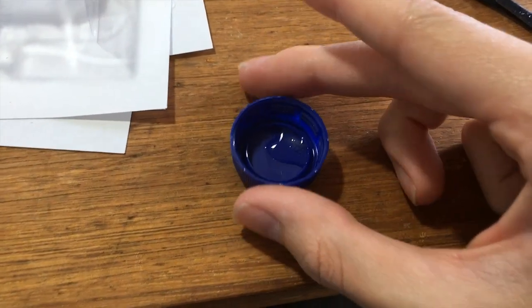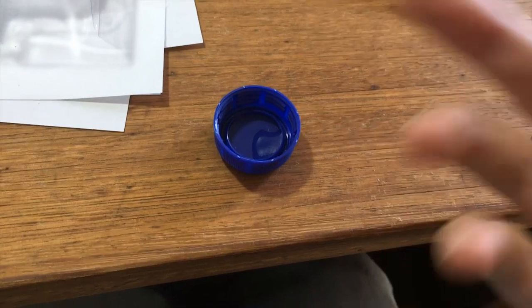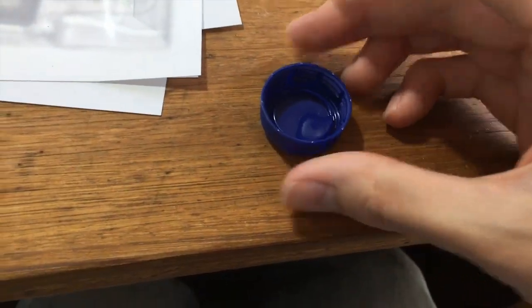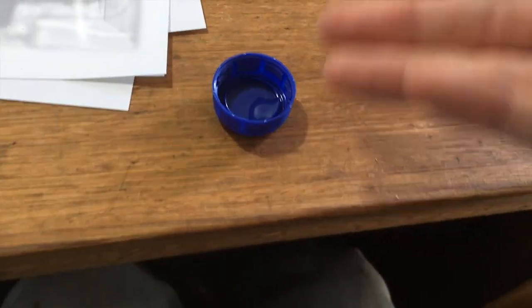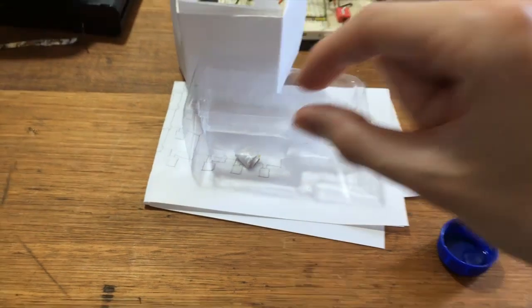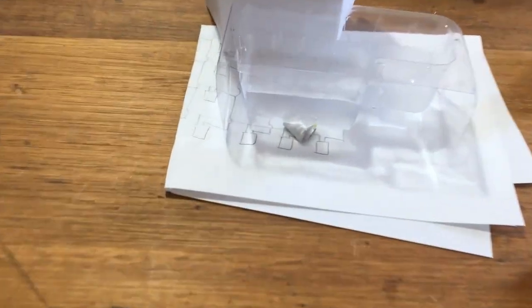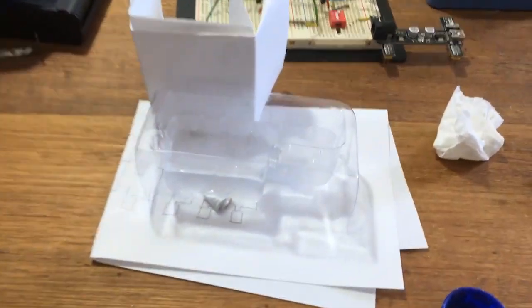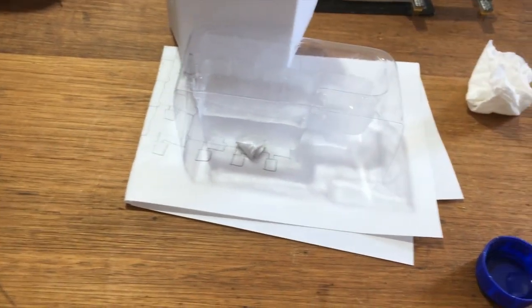Our first experiment showed that the melting point of this heavy water is slightly above that of normal water, so that does prove that there's some content of deuterium in the water. But this experiment should have showed that the ice cube of the heavy water sinks in normal water. I'm sure you've seen it before. It's pretty cool. But this stuff didn't sink, it just kind of floated.